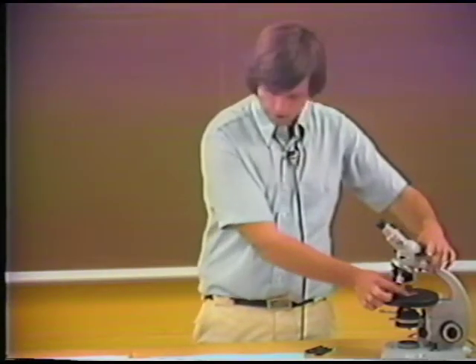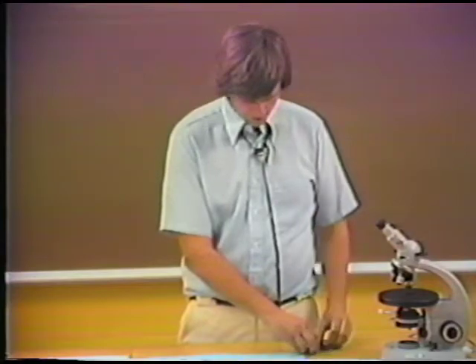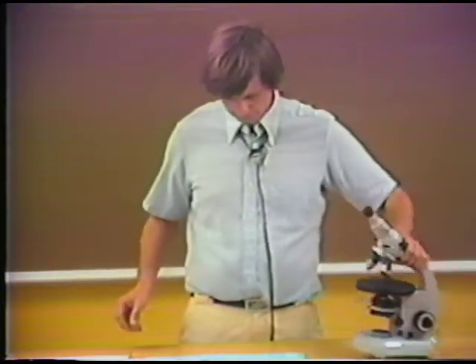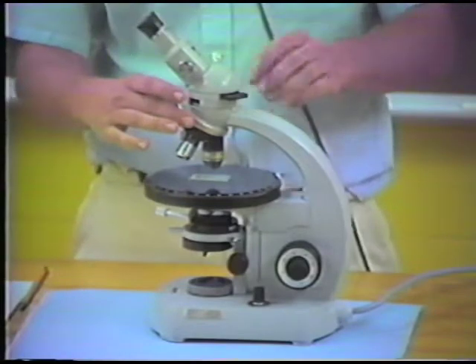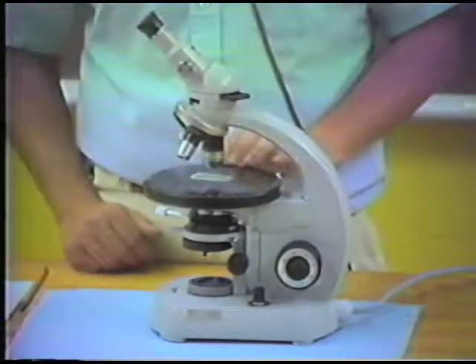So I'm going to go back to the thin section of the orthoquartzite. Now, the orthoquartzite, put it back on the microscope stage, and we'll look at the orthoquartzite now in cross-polarized light. And again, you see the nice first-order white interference colors that are imparted by the mineral quartz. The maximum interference color, again, is this creamy white sort of color.